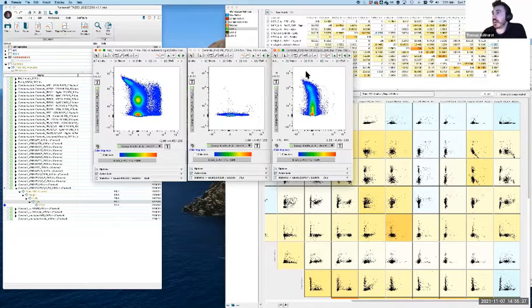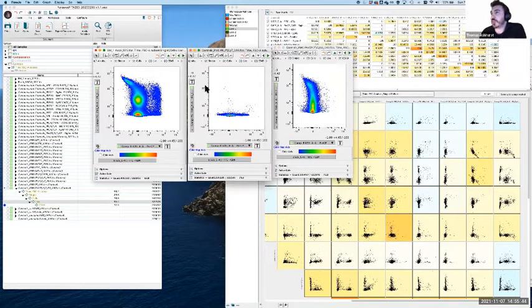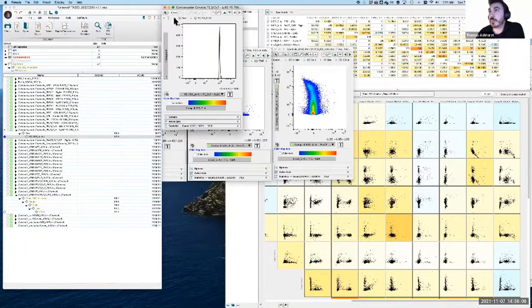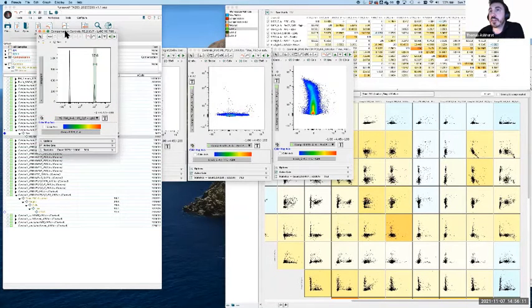Okay, oh, actually, that's interesting. They look slightly different. That's not good. Yes, okay, that's fine. We'll work with it anyway. What we're going to try and do with these FMOs, I actually realized this is the experiment where a few of the cell groups had dried out. I should have picked a different set. Nonetheless, we're going to look at both of these FMO controls alongside the sample, and for good measure we're also going to get one of our single stain controls, which we're not going to use immediately, but we'll come back to in a few minutes. I'm just going to put that to the side for now.